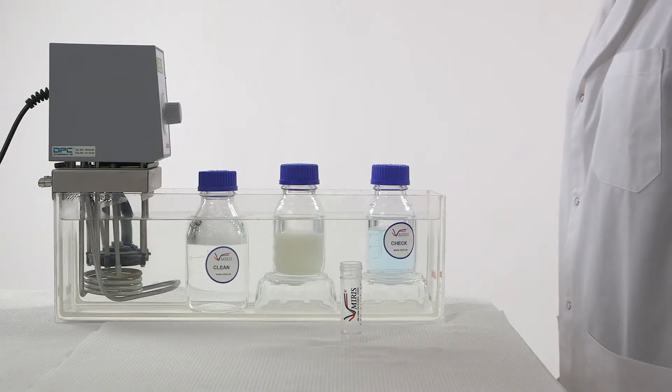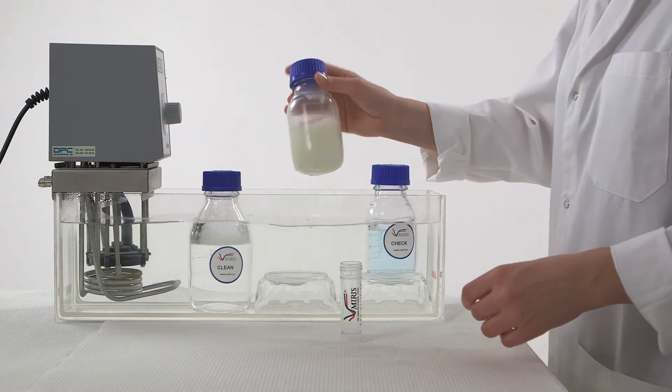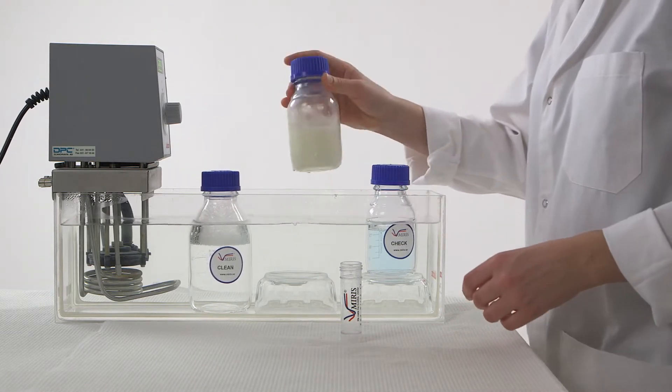When thawed, mix the milk gently and thoroughly. Do not shake the sample, as this introduces air bubbles.